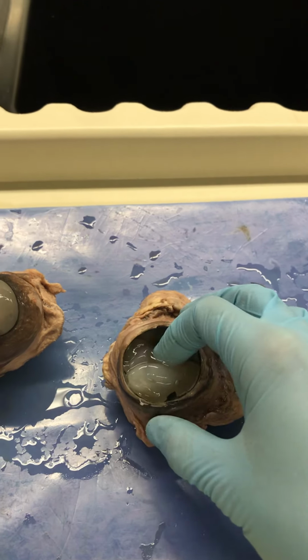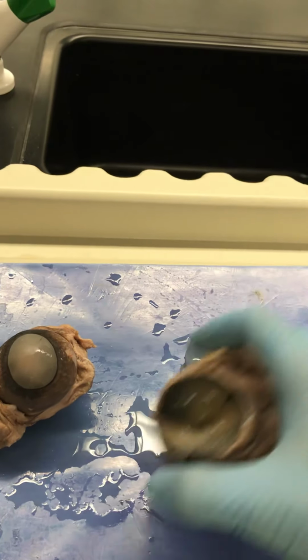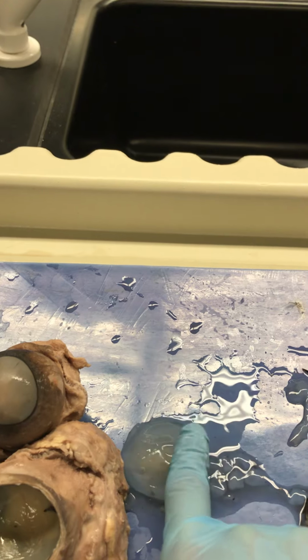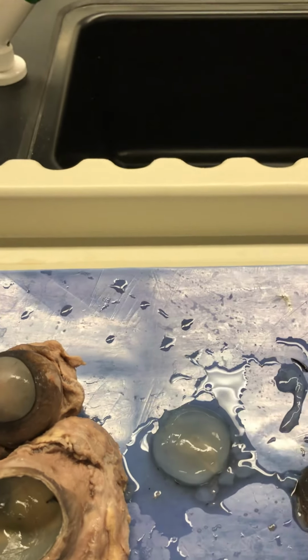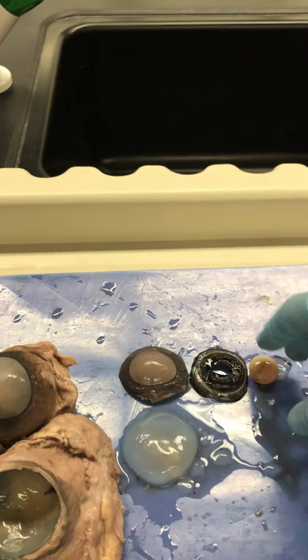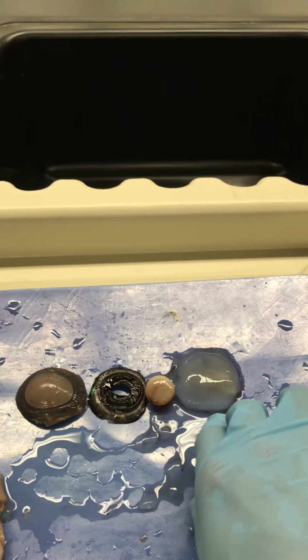This jelly here is called the vitreous humour. I'm just going to dump it out so I don't mess with the retina. Bloop. So that is the vitreous humour here, and it also helps to refract light. So we've got a lot of types of light honing structures here.